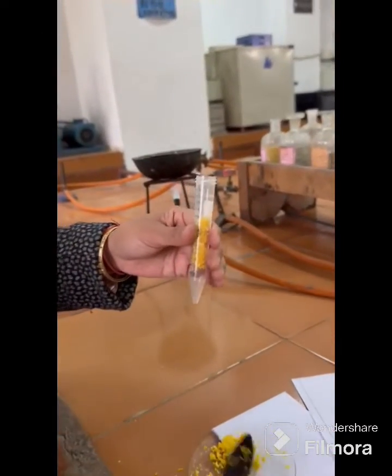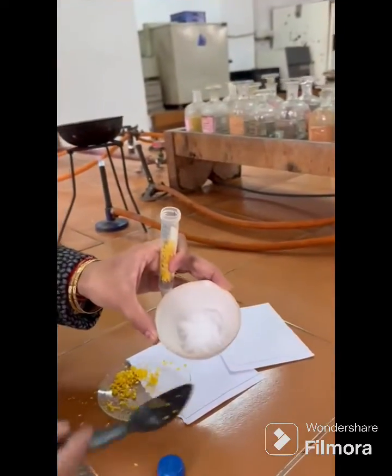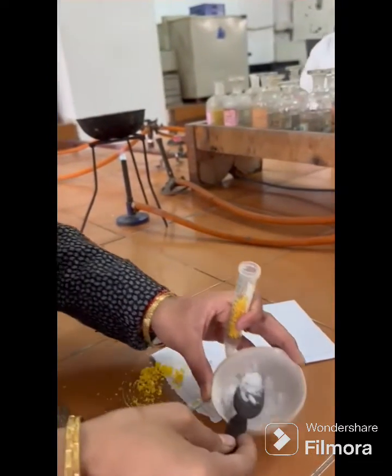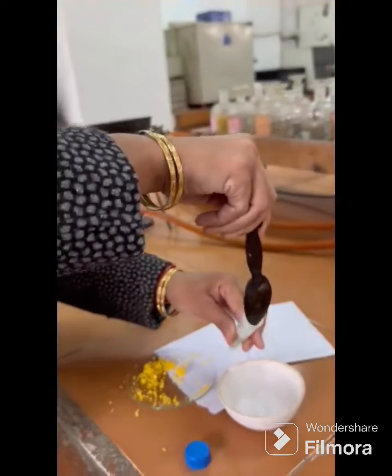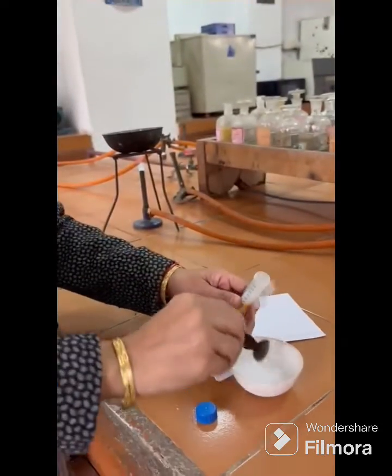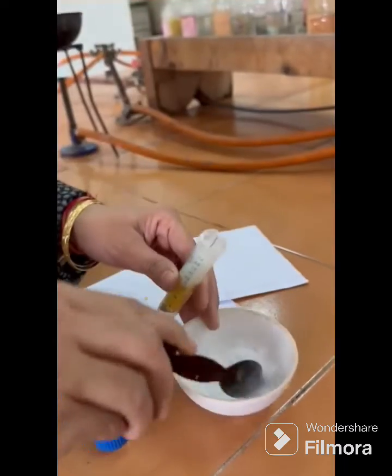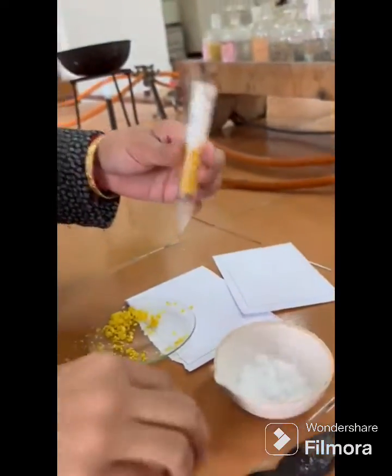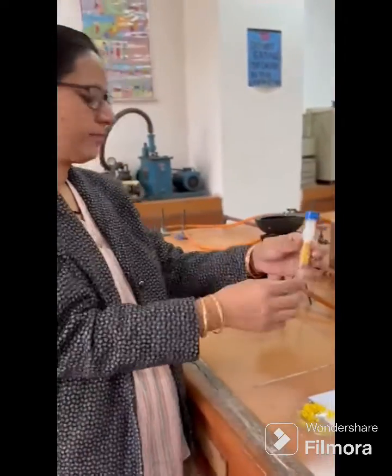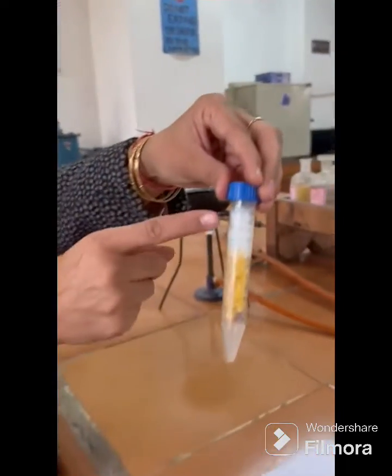Then fill it with crushed dry ice. Dry ice is solid carbon dioxide, which is used to extract limonene from orange peel. Cap it and seal it with the cap.